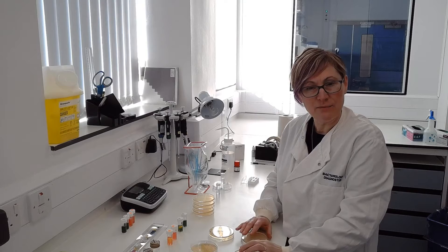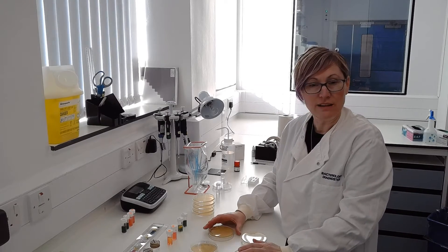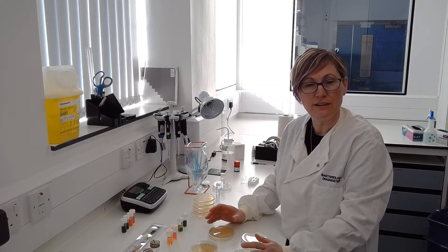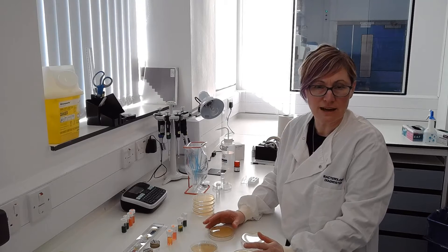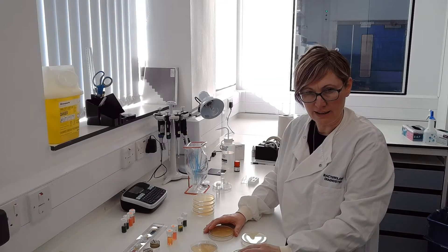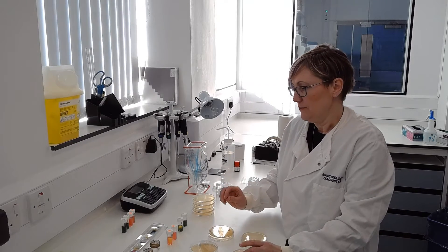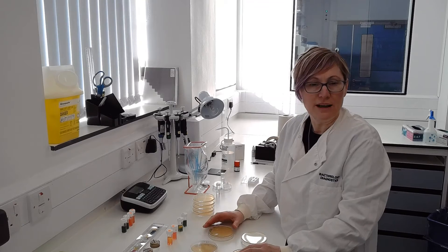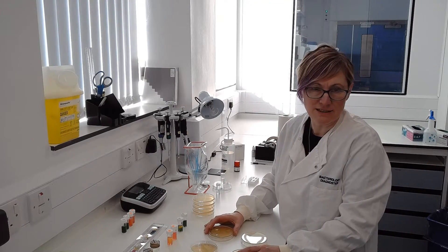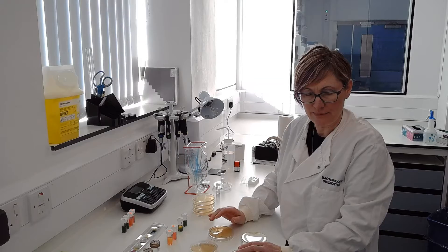We examine them phenotypically in the way that they look, describing their colour, shape and size, and biochemically in the way that they metabolise different substances that we provide in the media.